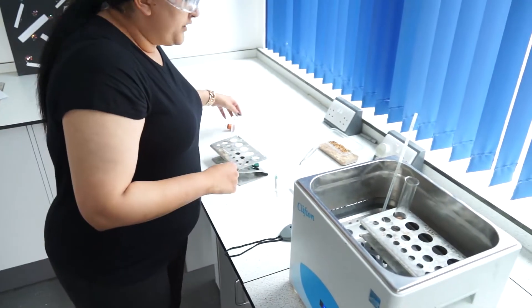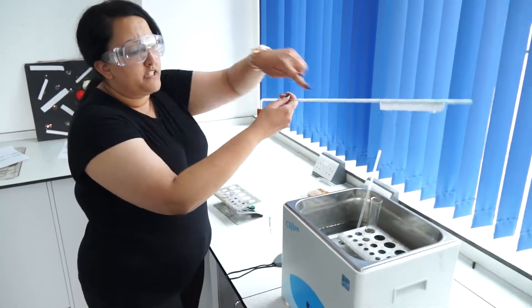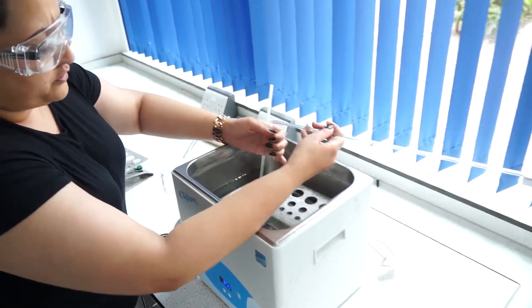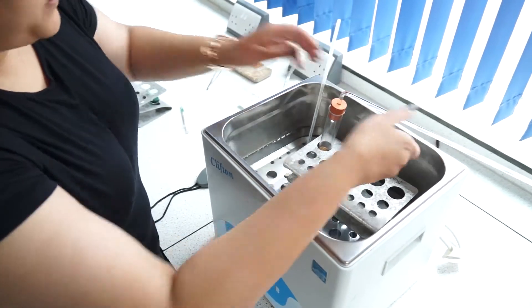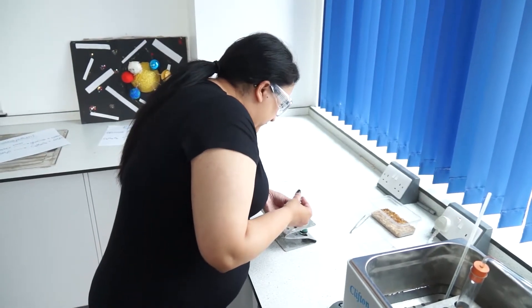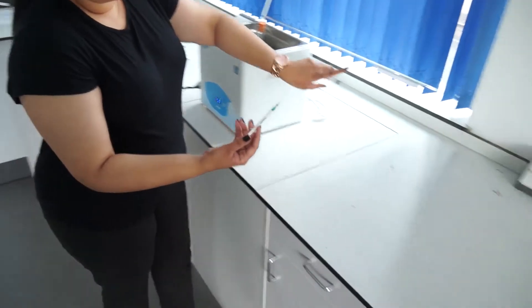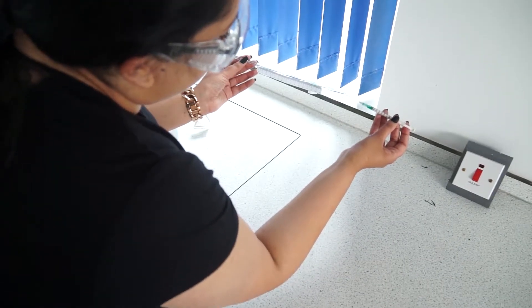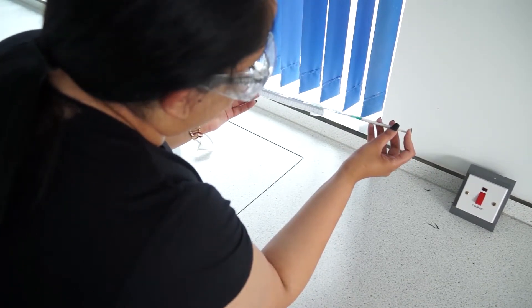After 5 minutes, very carefully add your delivery tube and bung on top. This can be a two-person job. Then get some dye in your syringe and insert it right into the bottom of the capillary tube, putting in just a small amount.